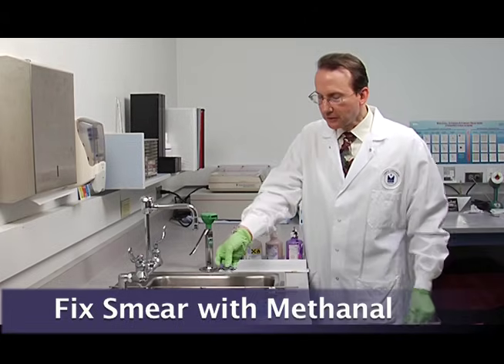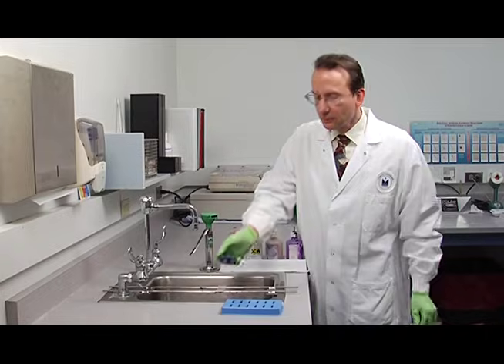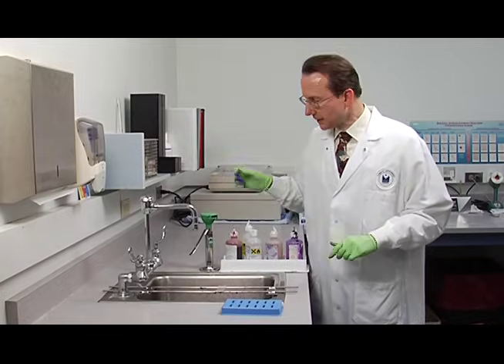This is the female genital tract smear and we'll set it right there. Fixing means to preserve the morphology of the cells.